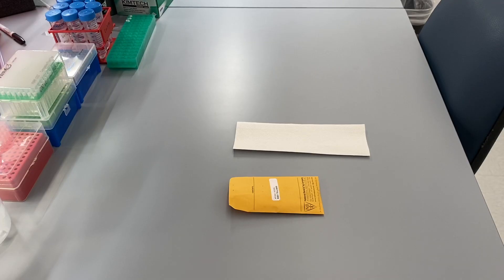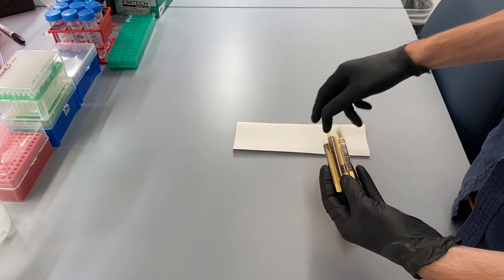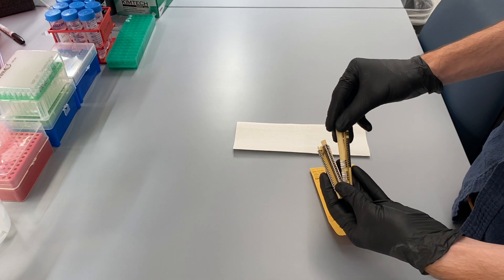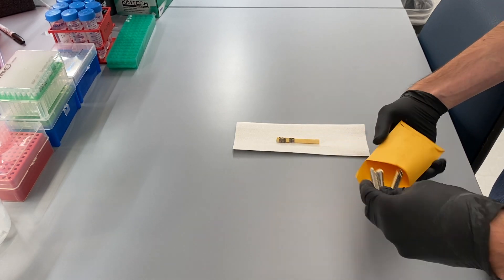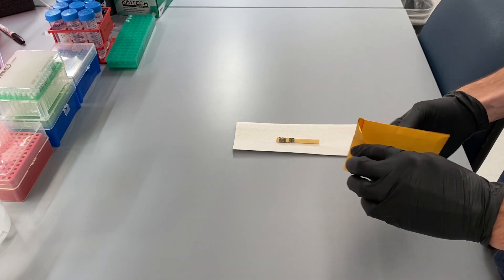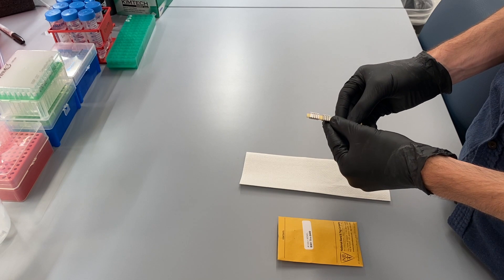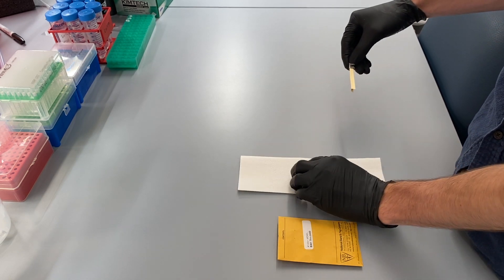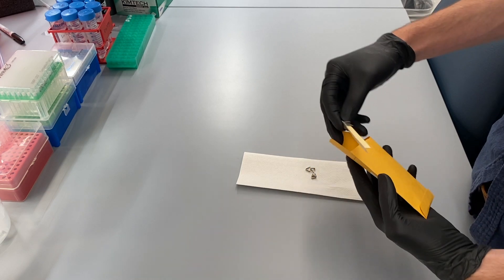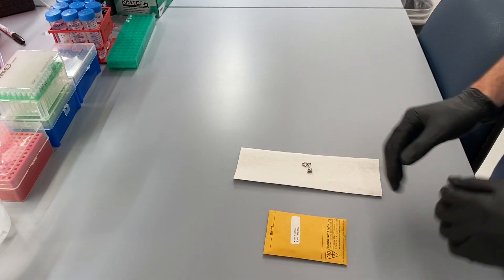It is useful to begin by knowing how many mice you have to tag that day. Always choose the tags from previously used batches. This helps to make sure that the mice are in order as you put them into your mouse organization sheet. For today's use, I will select the next four tags in the sequence that I have previously used in order to tag these mice.